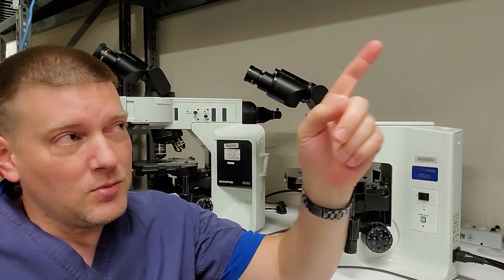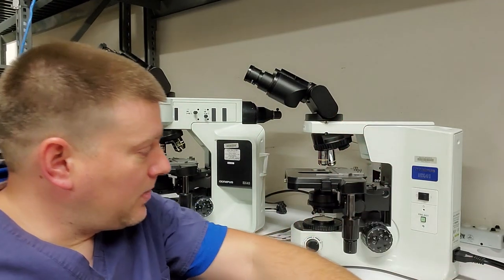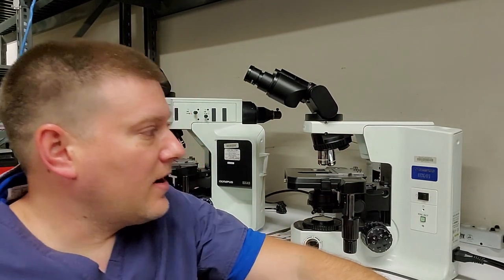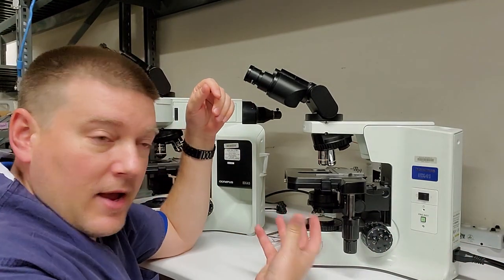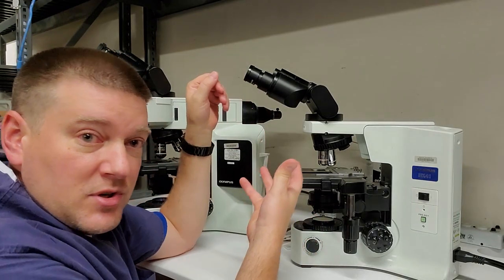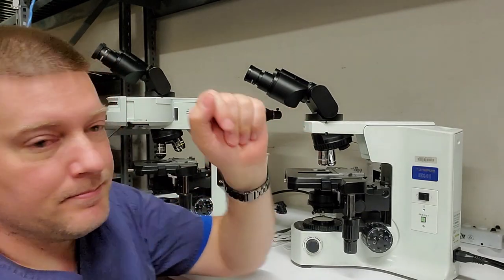The most common one is going to be called the bright field microscope. And the bright field microscope is like this guy right here. I've got an Olympus BX41. And what a bright field microscope is, it has a light at the bottom, shines up through your sample where it comes up into here and your viewer views it.